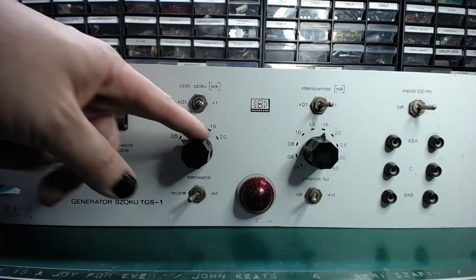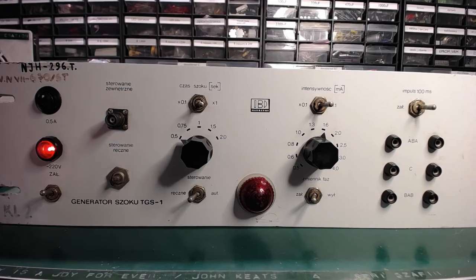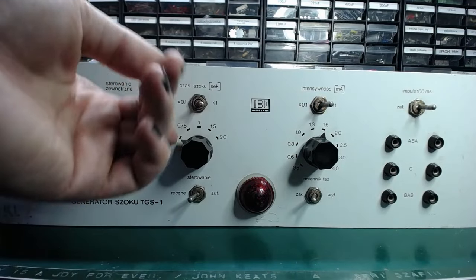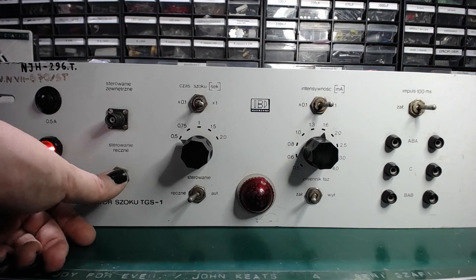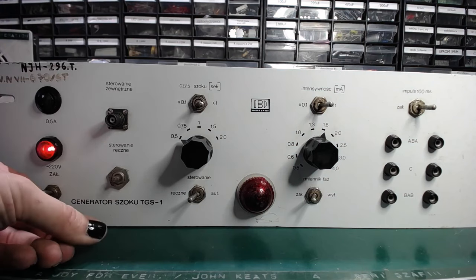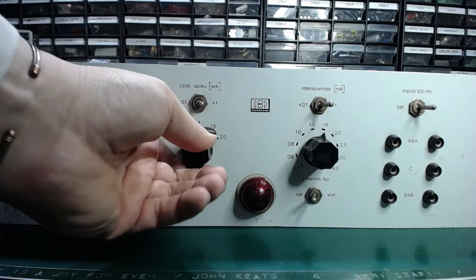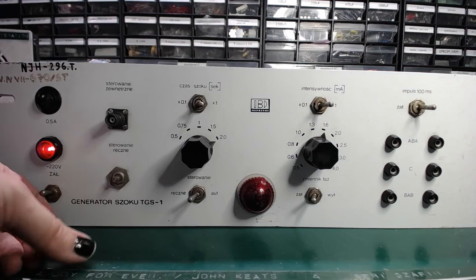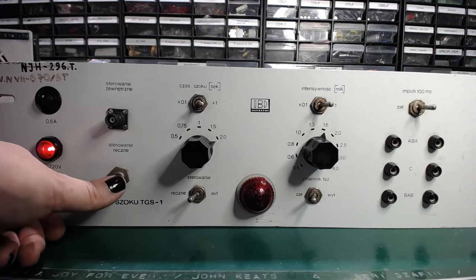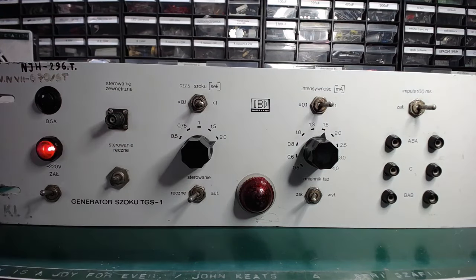Though the time constant we set here still affects the minimum shock duration. If I choose 0.5, press the button and release it immediately, it's very short. Change it to 2.0. It's not 2 seconds, but it's way longer than when at this position.